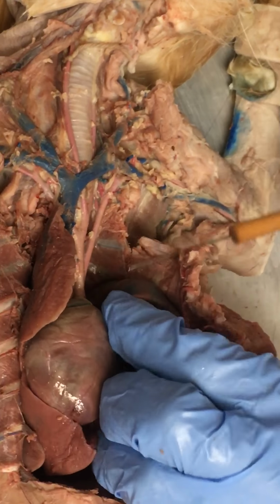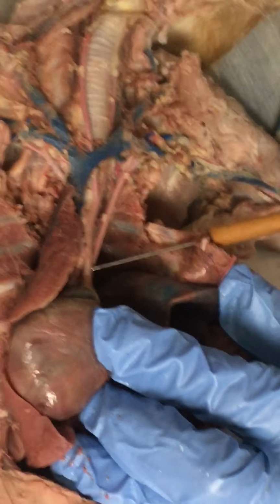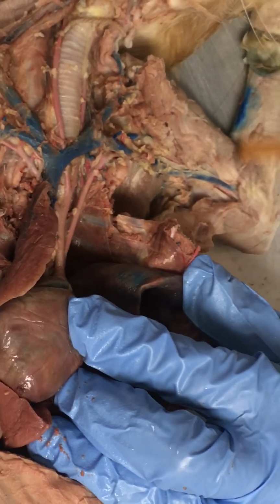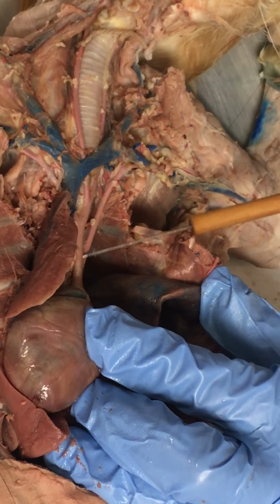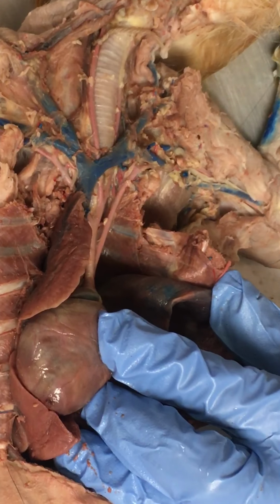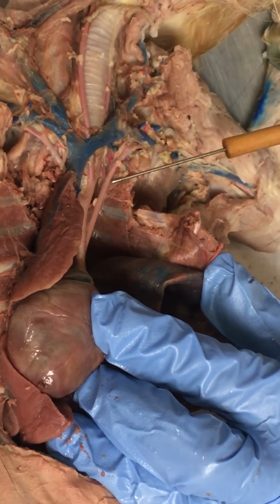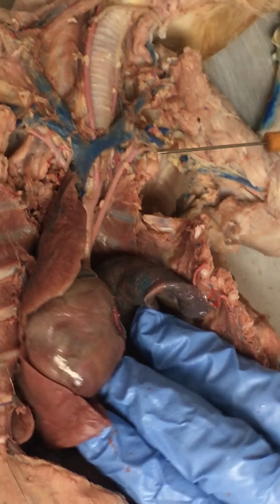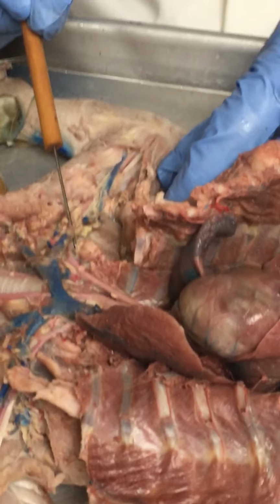On the other side, similar but different, because we have this other major blood vessel that comes off here, but there is no branch that goes to the head. So we don't call it the brachiocephalic because there's no cephalic component. It comes all the way up to the clavicle region and turns immediately and comes out to the arm with no branches going up to the head. So it's subclavian here, all the way up to here, and that's the subclavian region. After that, the naming continues like all the others.